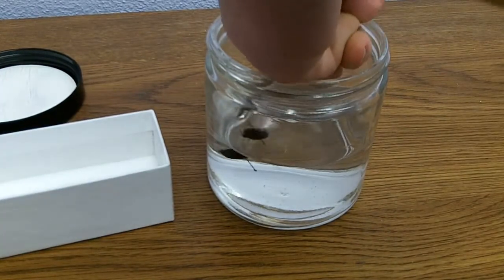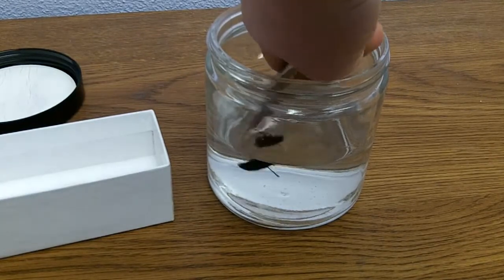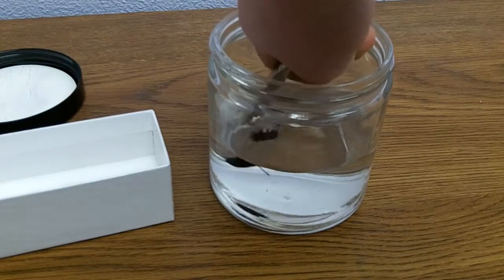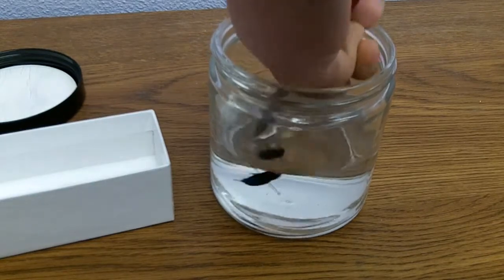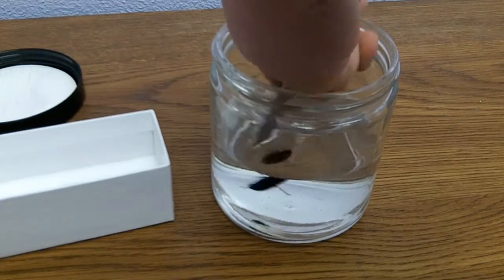I'm just going to stick the specimen in the jar and slosh it around a bit gently so no parts of the beetle break off.